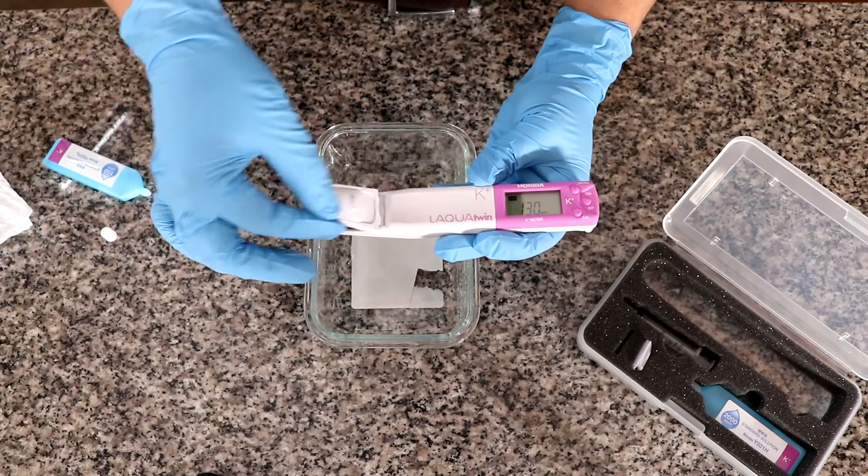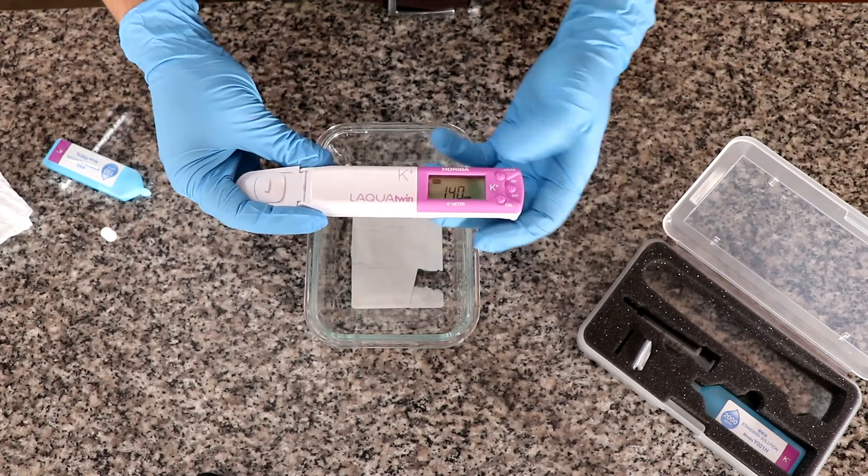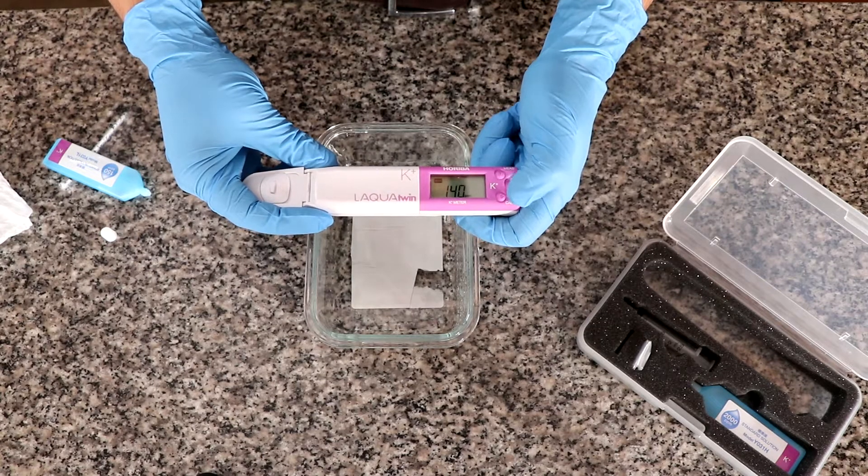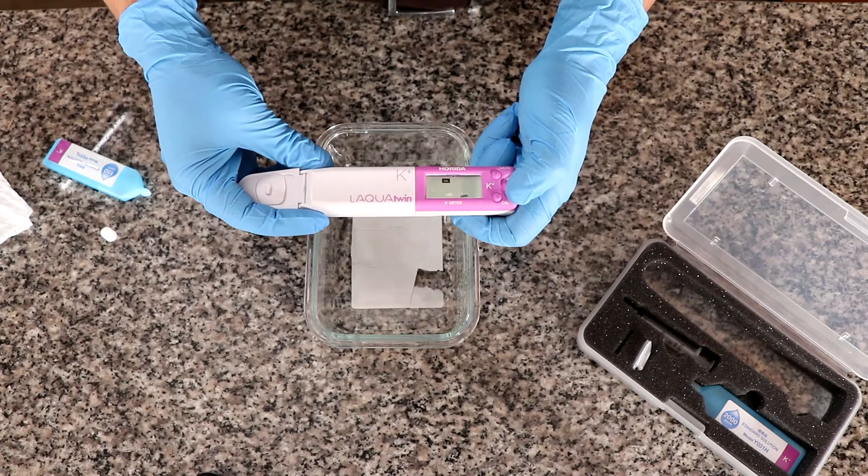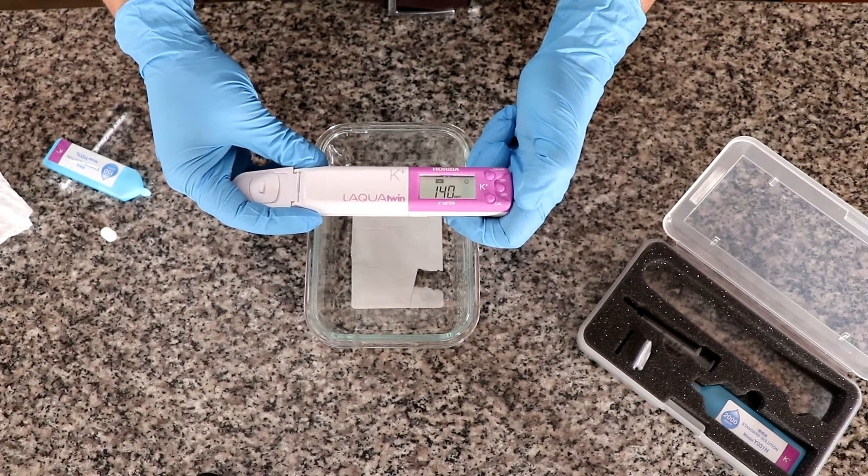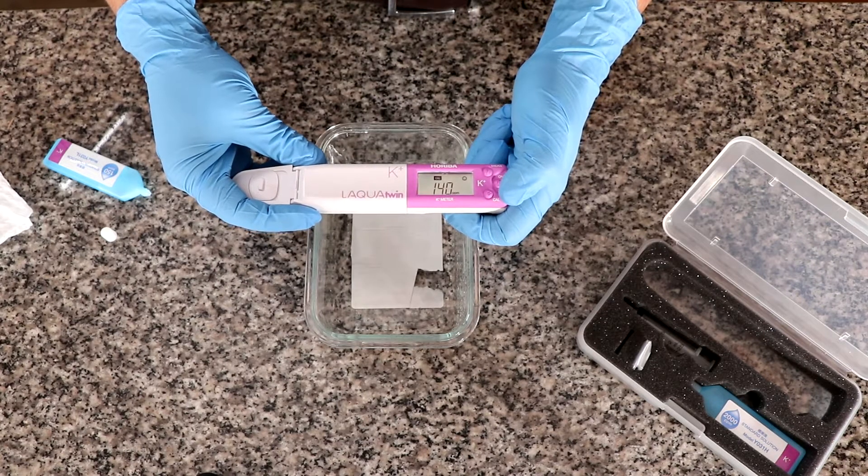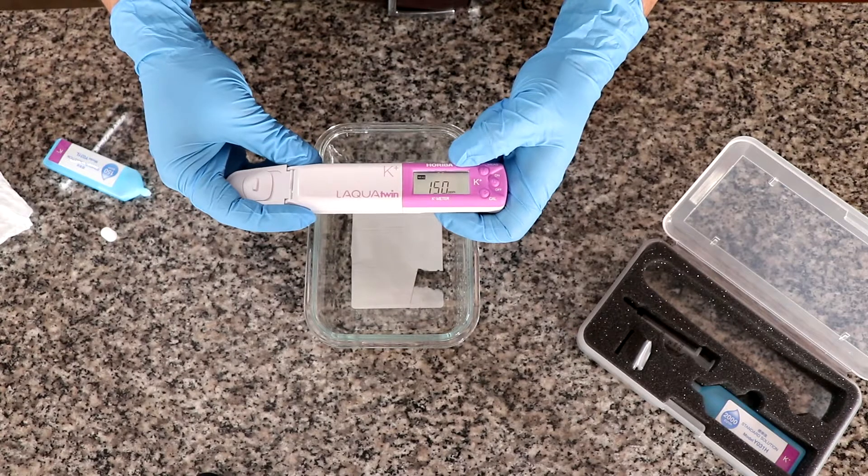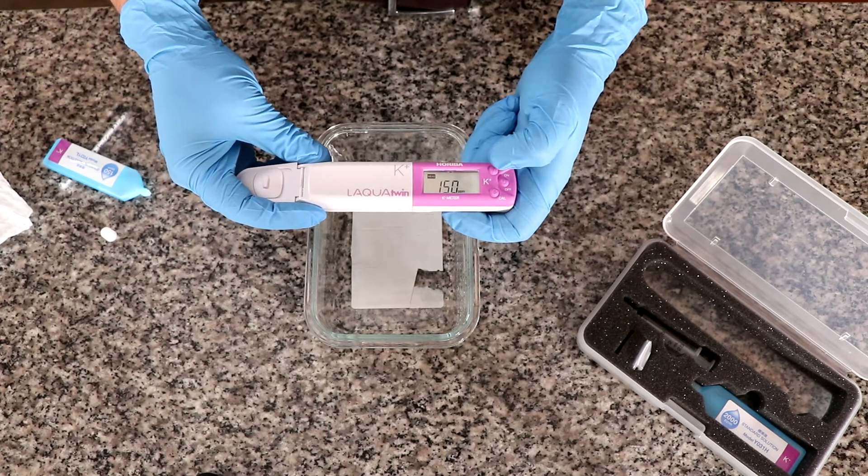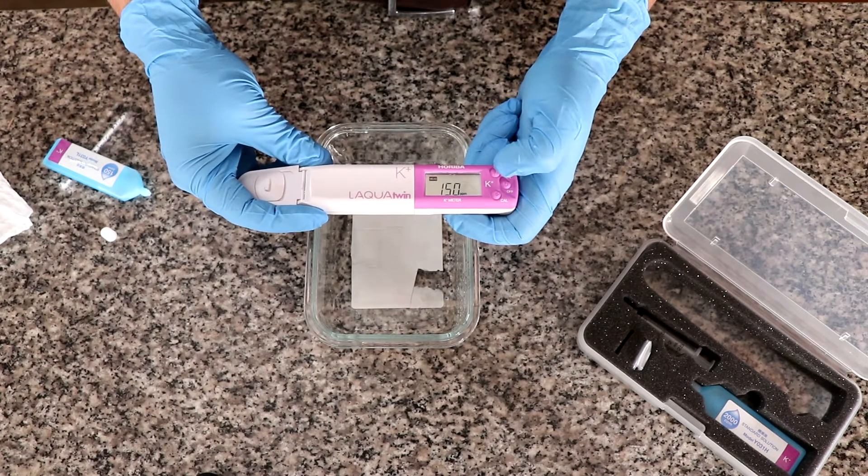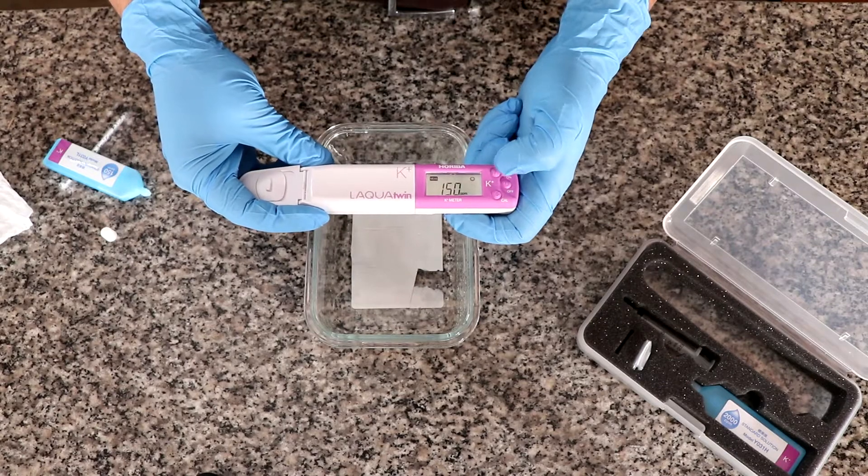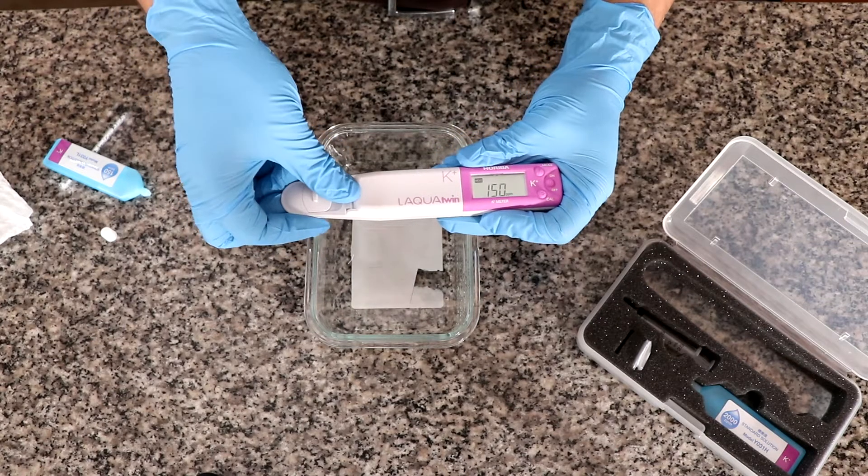Now I am going to close this and I'm going to hit the calibration button, 150 and I hit it again. And now it's steady and it measures 150 and we saw the happy face there. So we're done with the first point of the calibration.